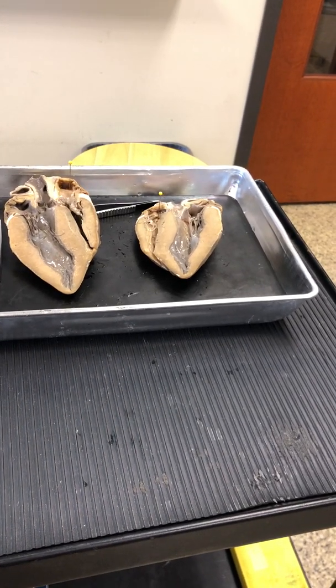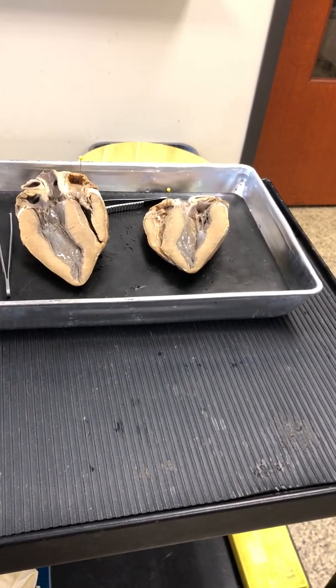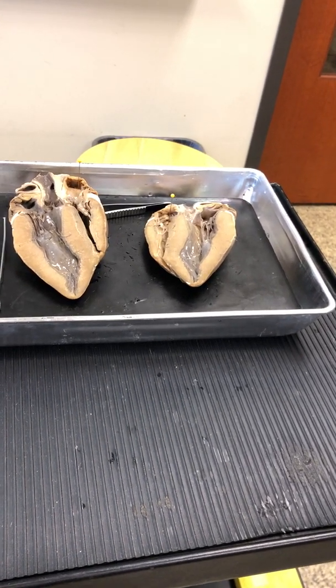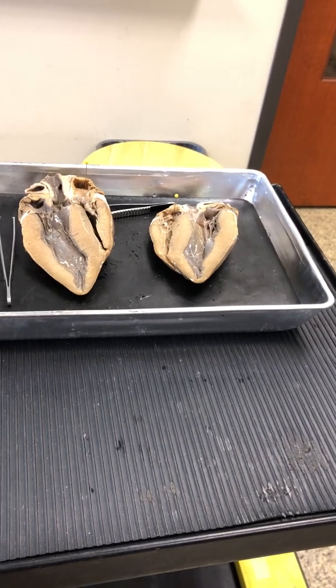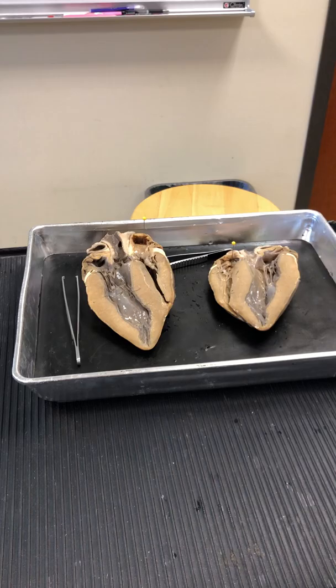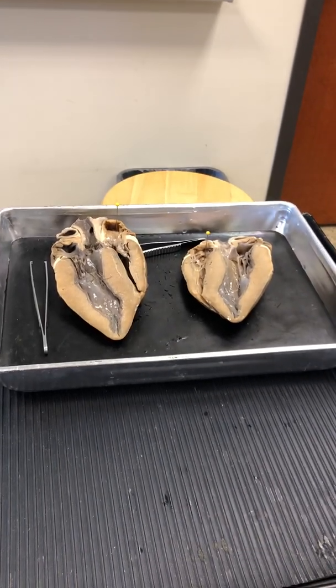The skewers are right here, and when you're done working with the skewers today, I will have that water, that container right there, that beaker filled with dishwashing water. We just put it in there to clean it up. All right. So skewers, use skewers.